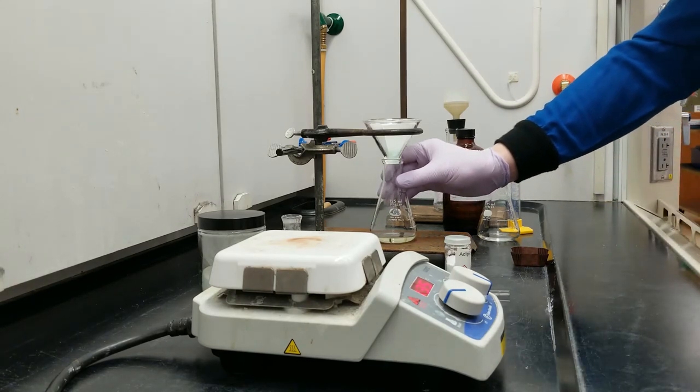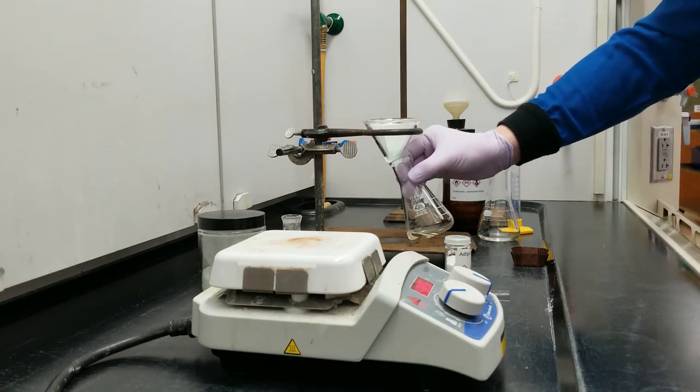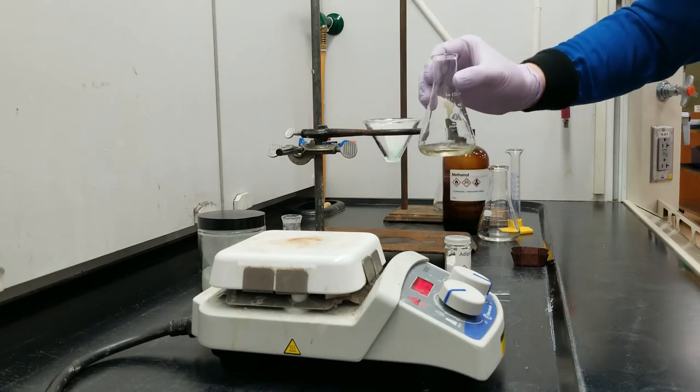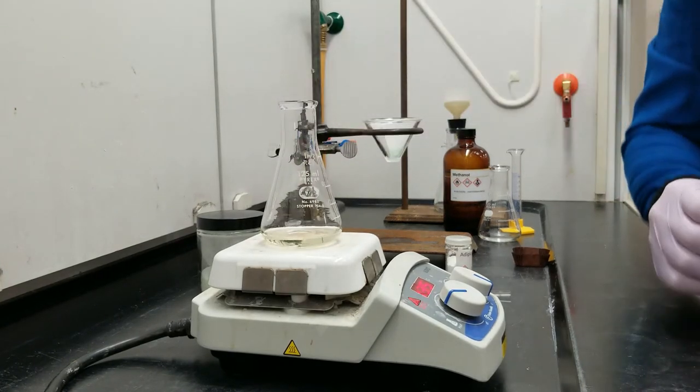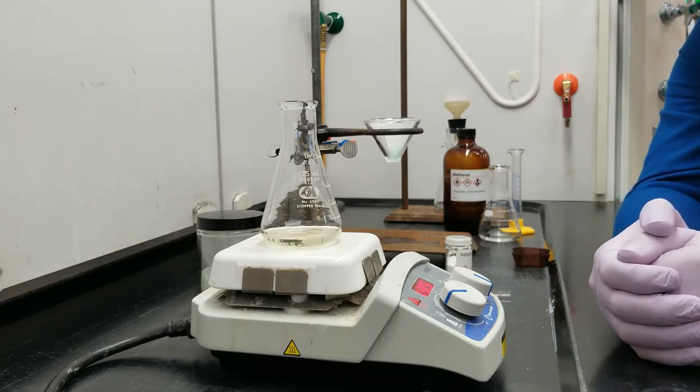So, that's about as patient as I am today. Might need one more drip in here, but let's roll with it. I'm going to start heating this back up to a reflux.